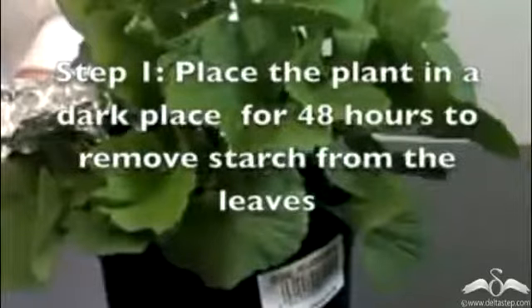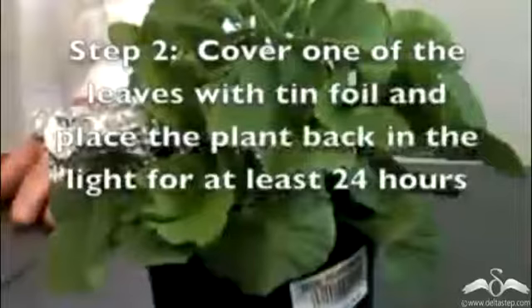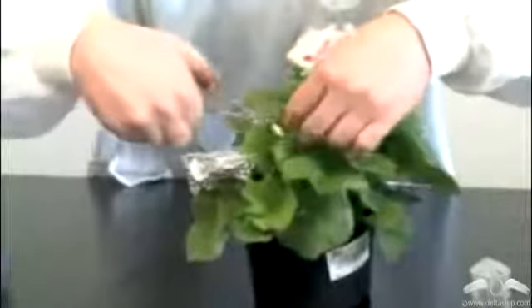A potted plant is kept in darkness for 48 hours. After 48 hours, it is taken out in the sunlight. One of the leaves is wrapped in foil so that it is not exposed to sunlight. And then both the leaves are cut from the plant. Let us see how he is doing this.